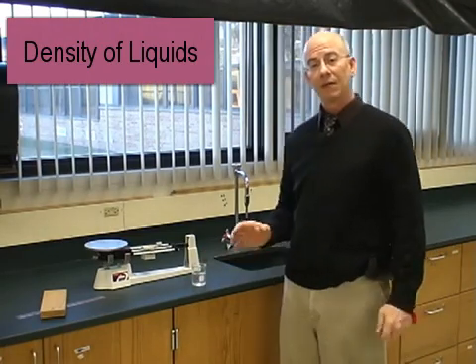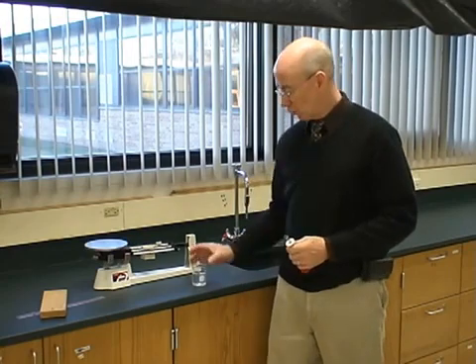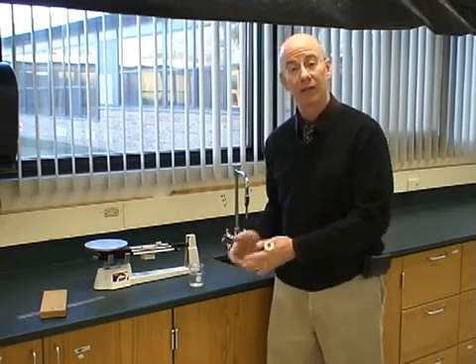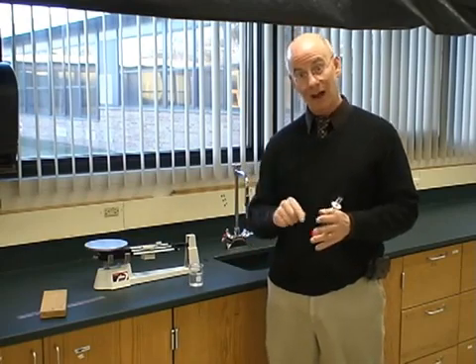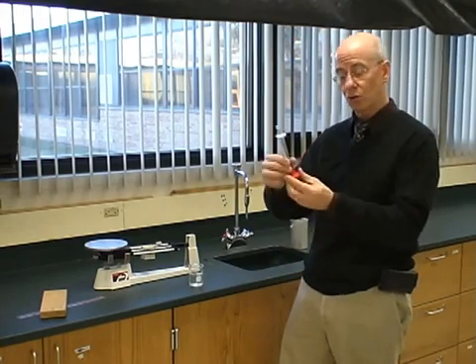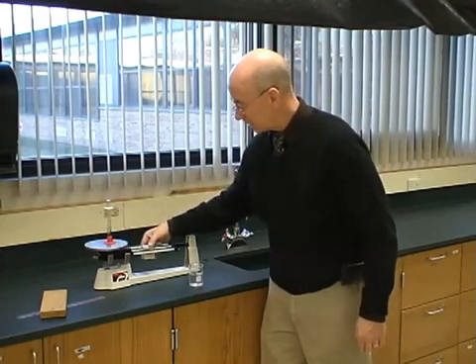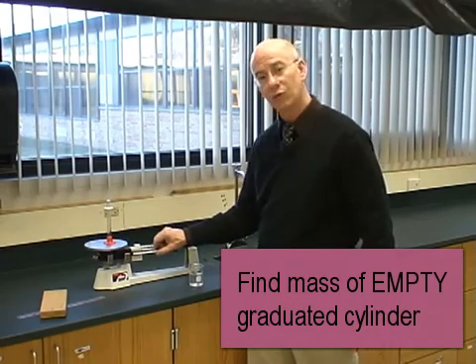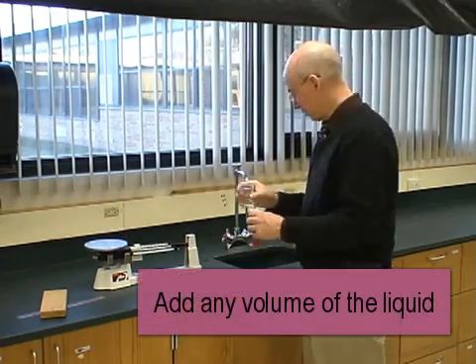Now, what do you do to find the density of a liquid? I have a beaker of some liquid, and people tend to want to use all of it — but you don't need to. Whether I use one drop or half of it, I can find the density, because all I need is a particular mass and its corresponding volume. To kill two birds with one stone, I'll use a graduated cylinder, and I'll first find its mass — just over 25 grams.